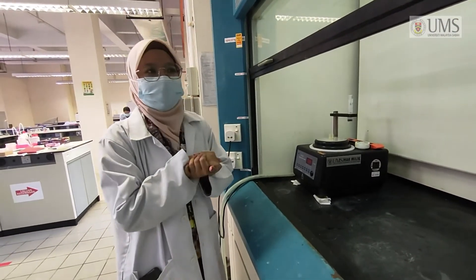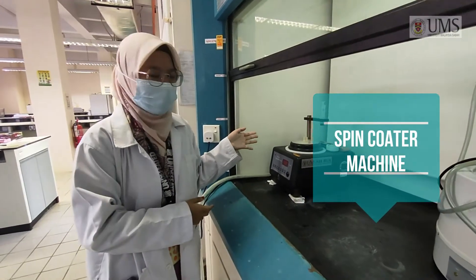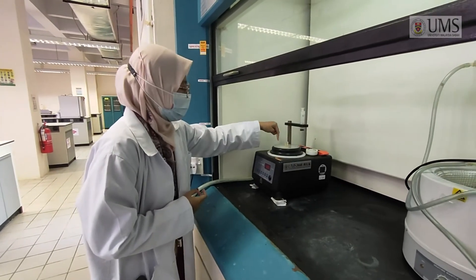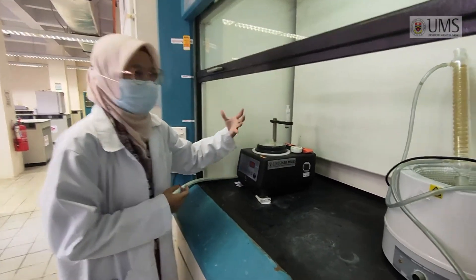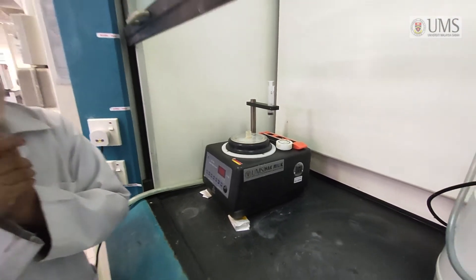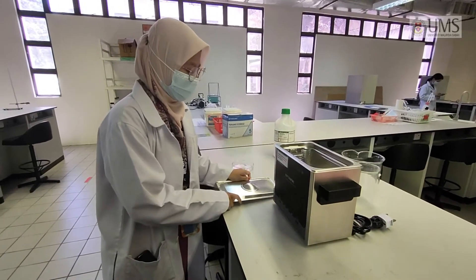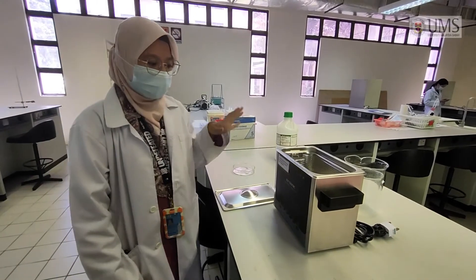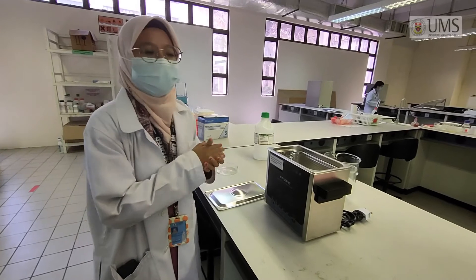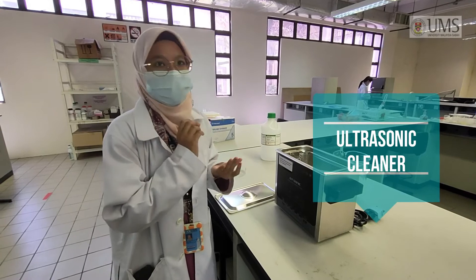I will show you another instrument that we have in our lab. This is the vacuum spin coater. This spin coater consists of three units and is used to spin the small substrate — we usually use organic substrate. Next, this is the ultrasonic cleaner. We use this to clean the glass before we deposit a substrate onto the glass.